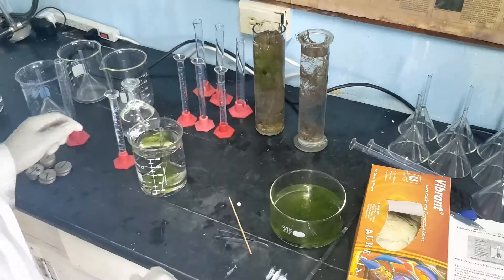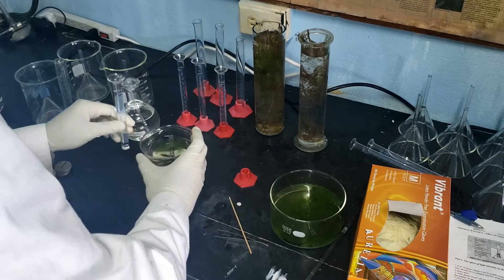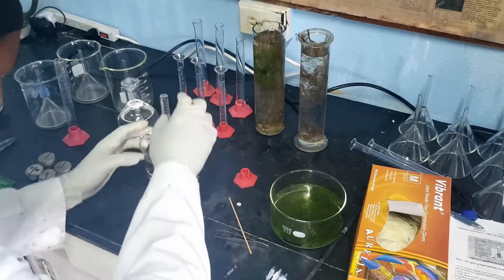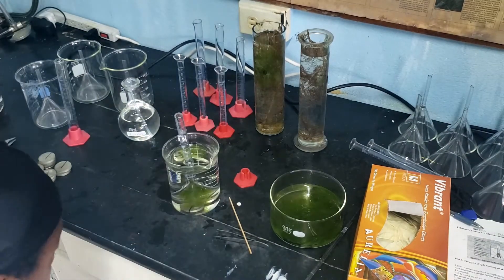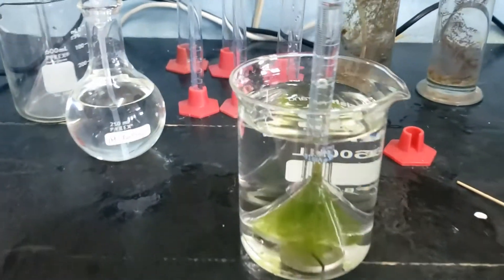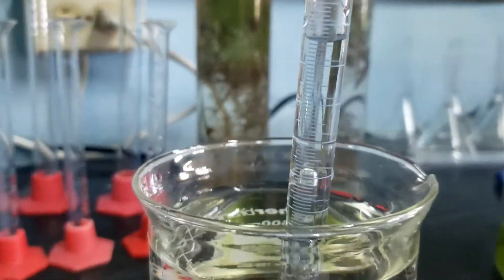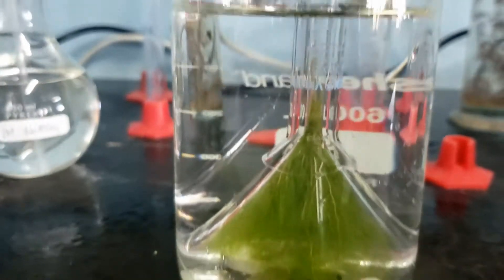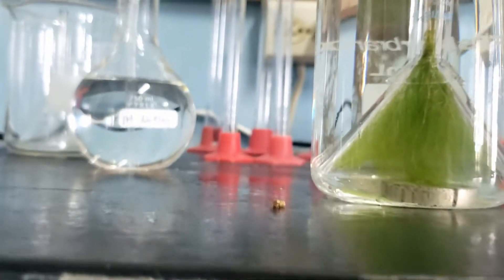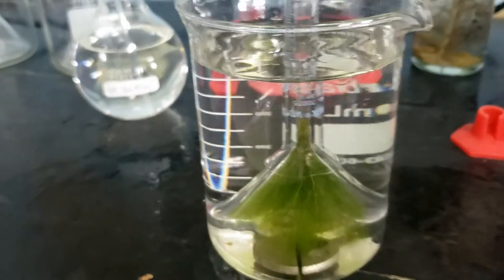The final step is to invert a tube filled with the solution over the nozzle of the funnel. Normally I would use a test tube, but in this case, to make measurement easier, I'm going to use a 10 ml measuring cylinder. Any oxygen produced will displace water inside the tube, so the change in volume inside the tube will be equivalent to the change in the amount of oxygen produced by the pondweed. The weights or coins placed underneath the funnel give some space between the funnel edge and the beaker.